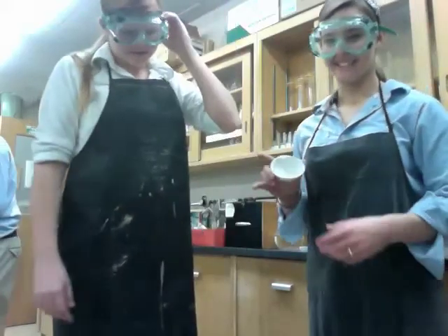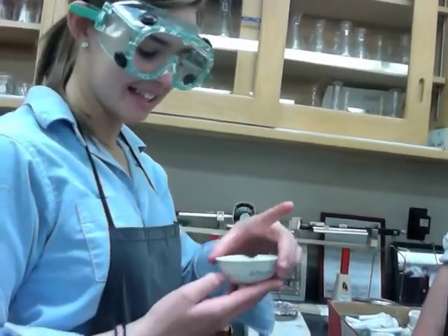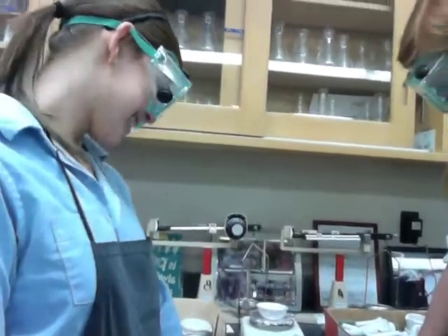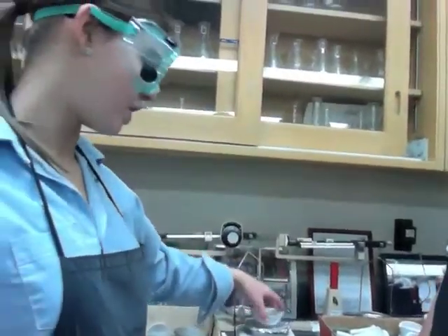So, now we're going to weigh it. You're figuring, I'm not telling you how to do it. It's 39.5.